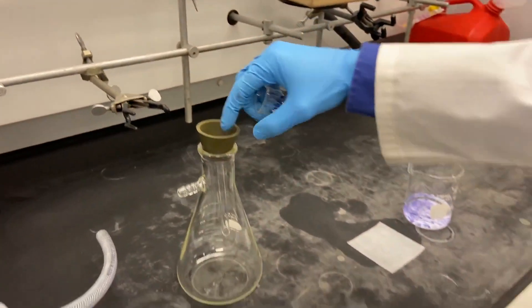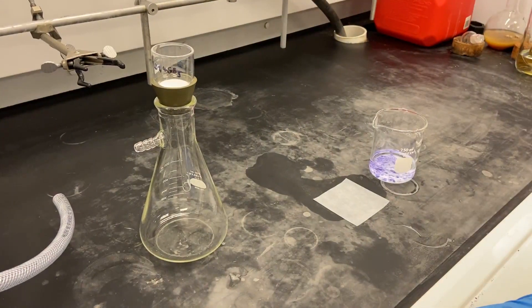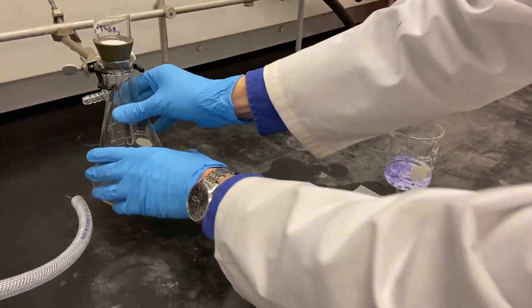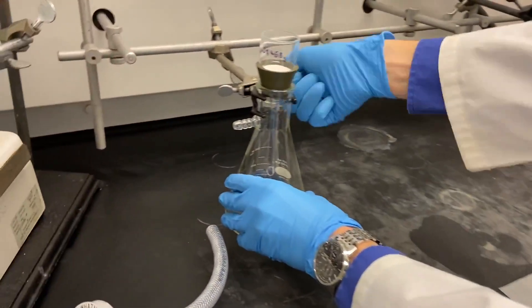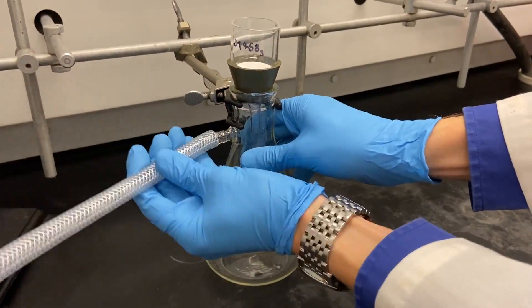It tucks in perfectly on this rubber cone, and now this is a safe situation. You should always put your flask in the clamp because when you connect the hose to it, it could be that the hose would throw it over.